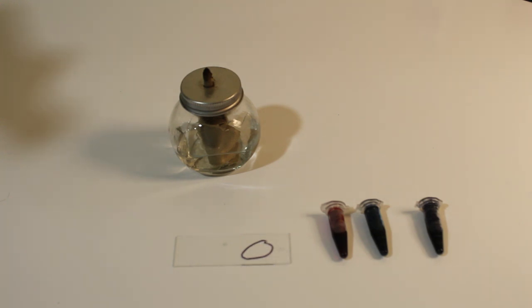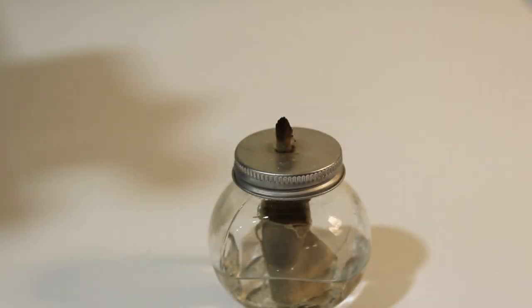You then need to let this sit and dry in the air until it is completely dried. Once your sample is dry, you're going to want to heat fix it. This will bind the cells to the slide as well as kill them, assuring that the dyes have good access to the inside of the cells.